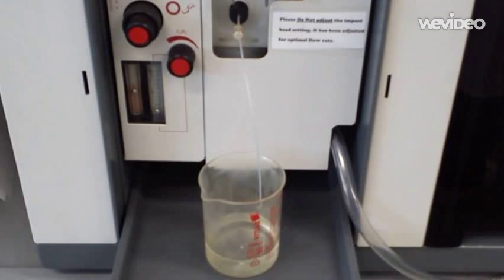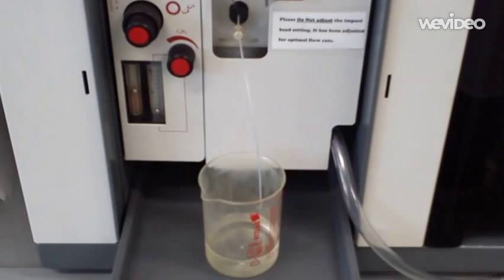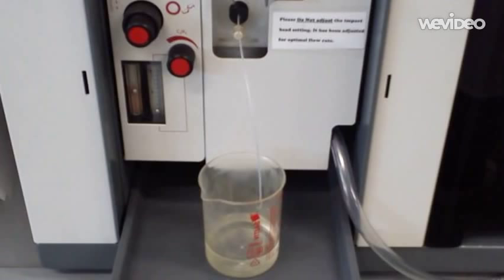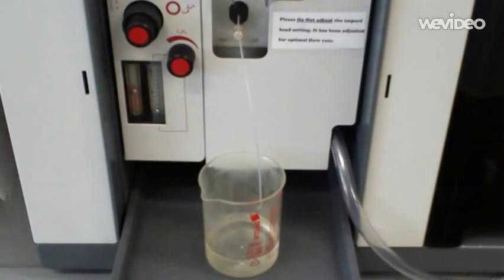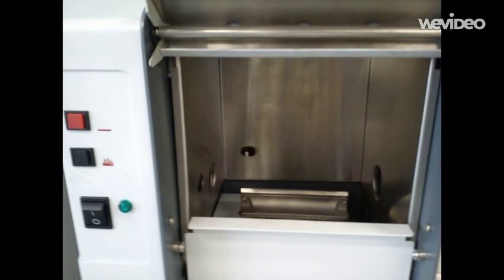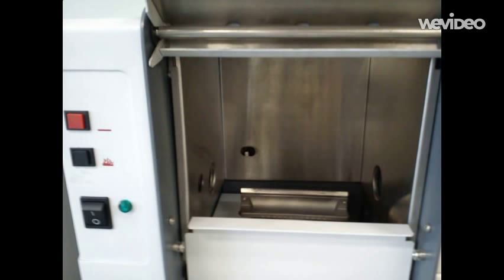A beaker of water is used to flush out the system, which may take a couple of minutes. A beaker containing a blank is then analysed, followed by the sample of interest. When finished, the machine is again flushed with water, followed by the gas valve and extraction system being switched off.